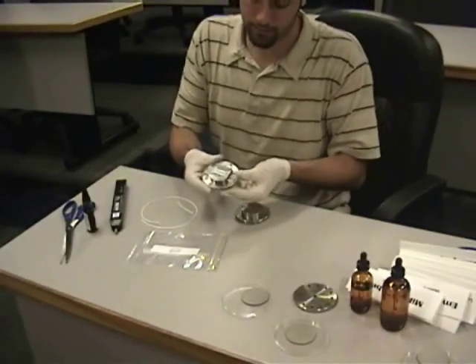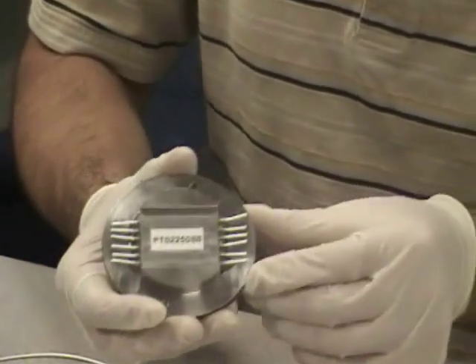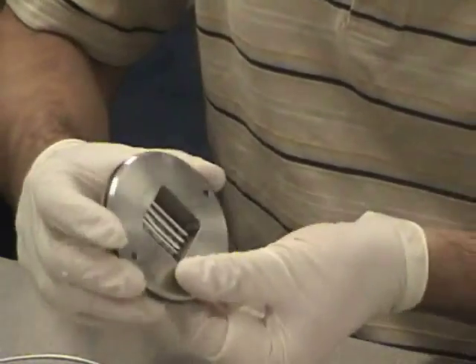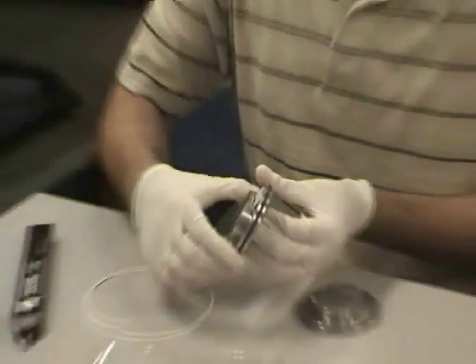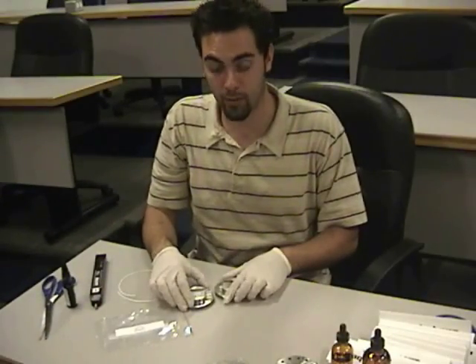When the sample is completed, it should look like this, with six glued on the outside as well as the inside, with an O-ring around your plate. And that is how you prepare a hollow fiber sample.